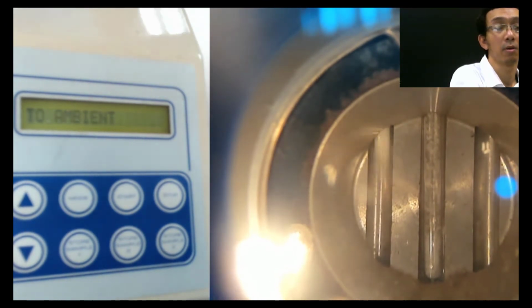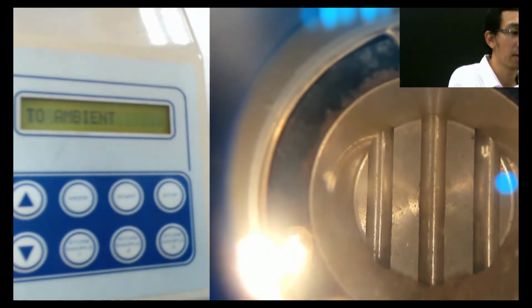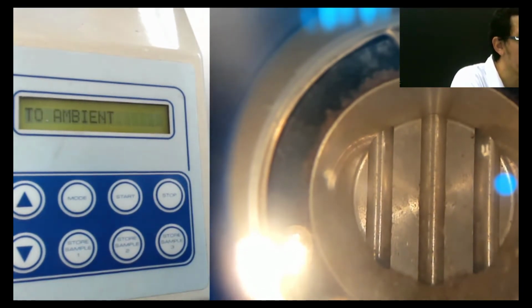So I put a lot more, but it's okay. I think you can see. I think it's clear. When it's melted, you can see actually. But the middle one is... Let me remove this color. Oh wait, no, I forgot.